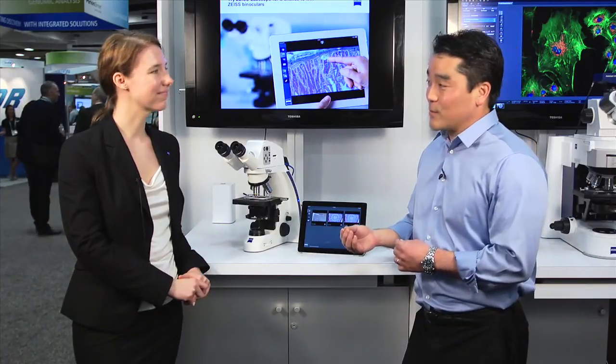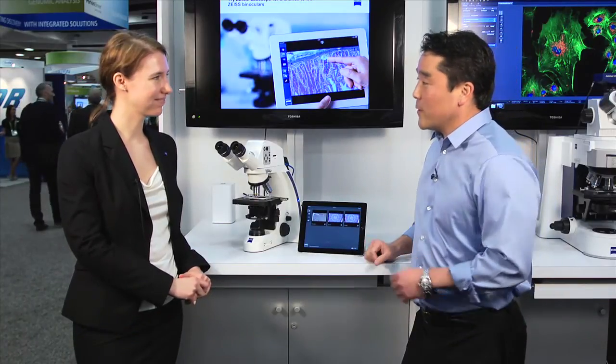Hi, I'm here with Maya Everett, who's a marketing manager for Zeiss. Maya, you're going to be telling us a little bit about the PrimoStar HD, which I know is a microscope that you developed specifically for the classroom. Can you tell us a little bit about it?